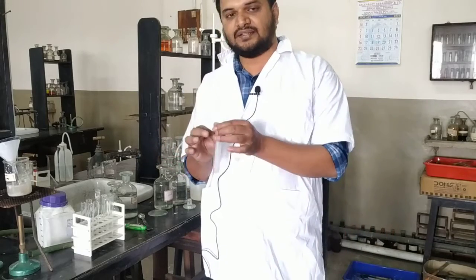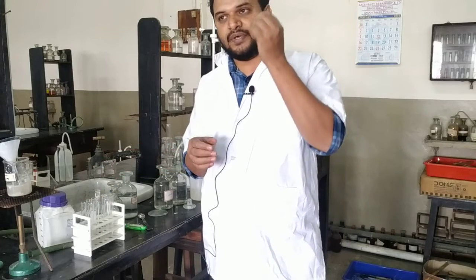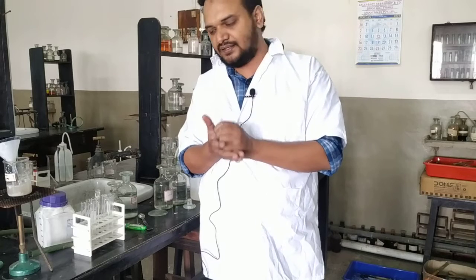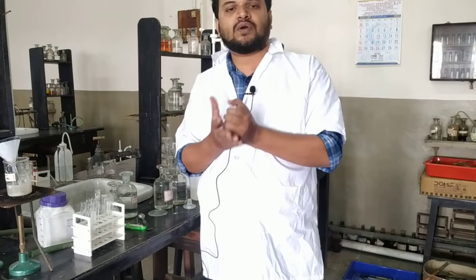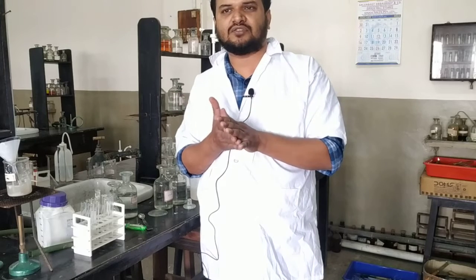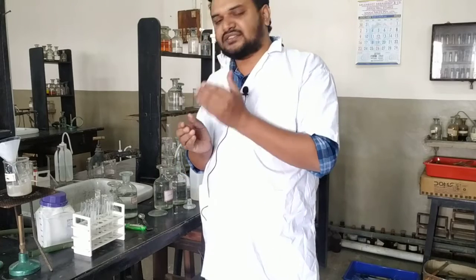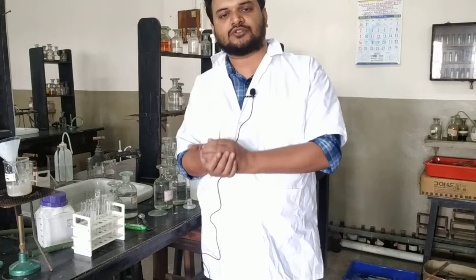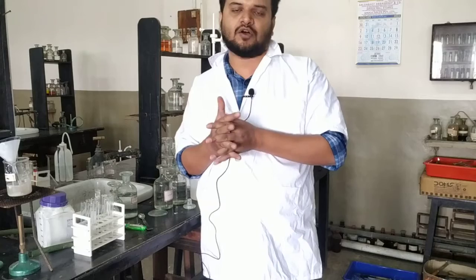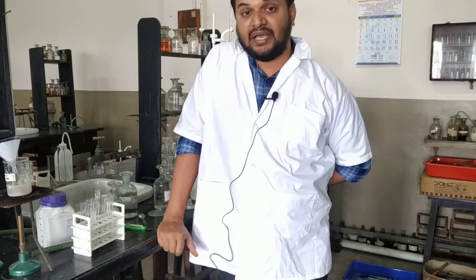So what you will write in the anion analysis: first you will write the preliminary test, a pinch of salt taken in a test tube, dilute H2SO4 added and heated. No characteristic observation, like no evolution of colored gas or gas with characteristic smell. Experiment number 2, concentrated H2SO4 added to a pinch of the solid salt, heated, no gas with characteristic smell or color obtained. Both these experiments give you an idea that sulphate may be present.